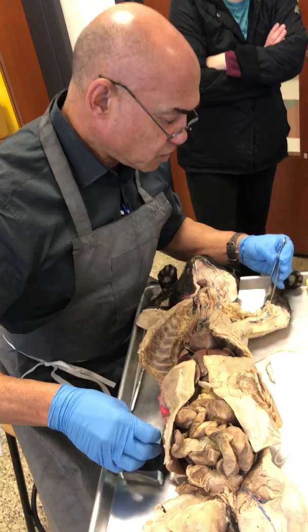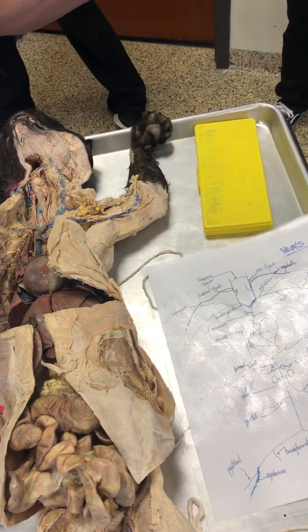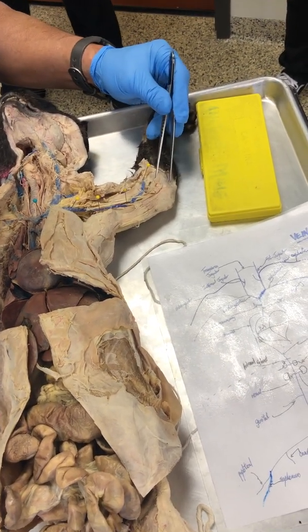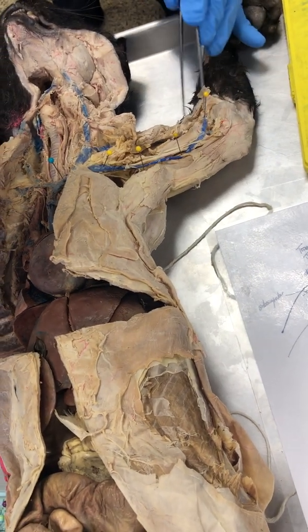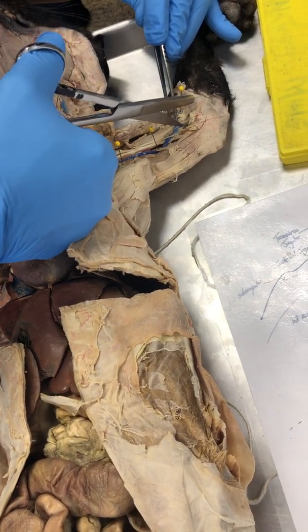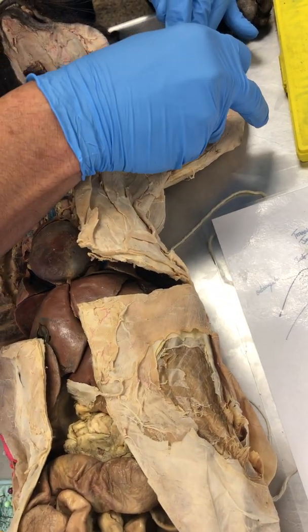And then, folks, it crosses over there. It comes from the thumb side. There's the thumb. And what is the bone on the thumb side? The radius. So that is the radial vein right there. All right, now I drew that in. For your information, on some of these big cats we can actually see the other one on that side, called the ulna, which I haven't labeled.